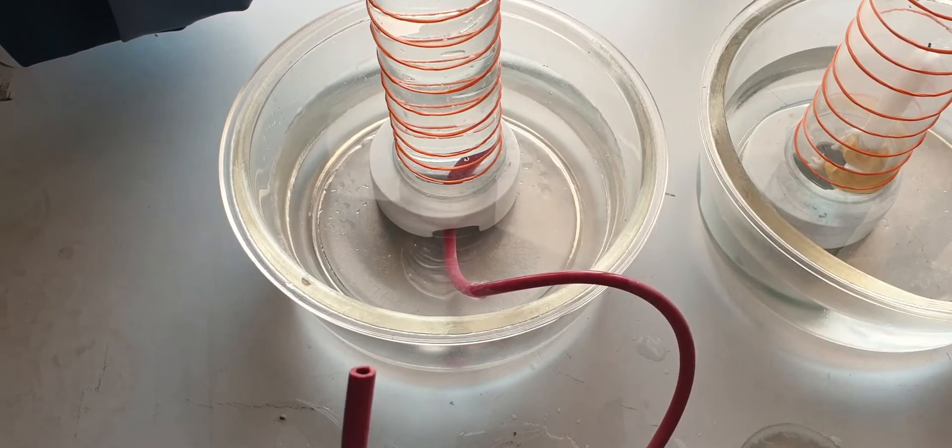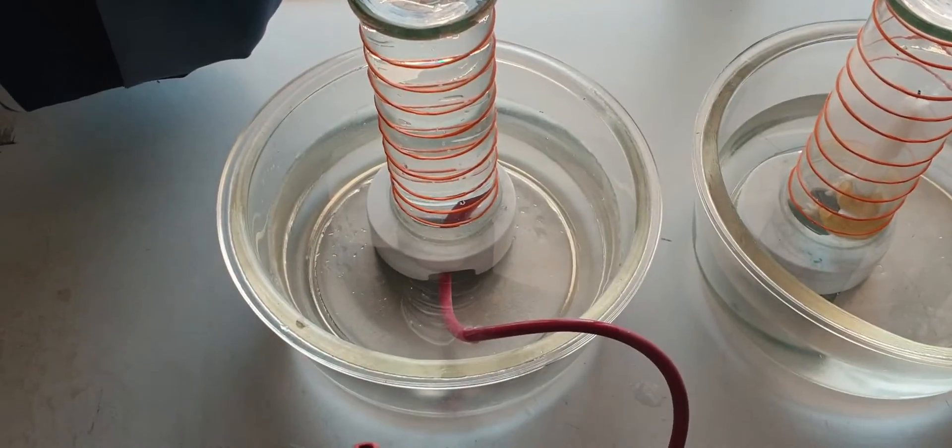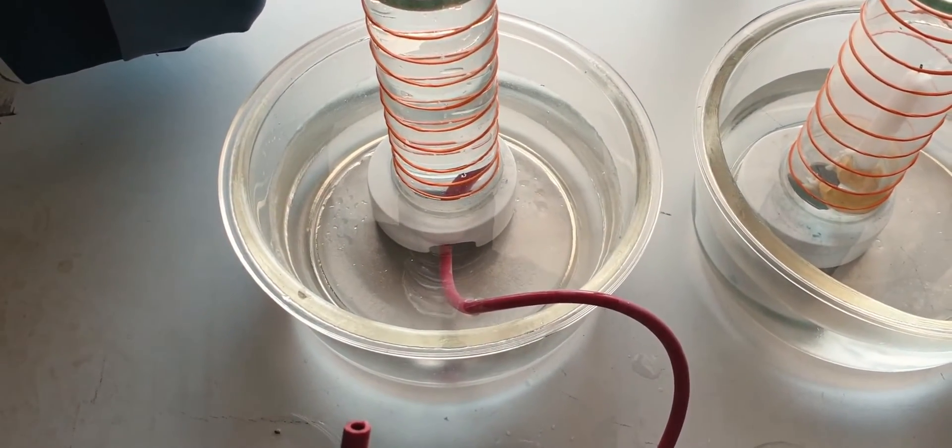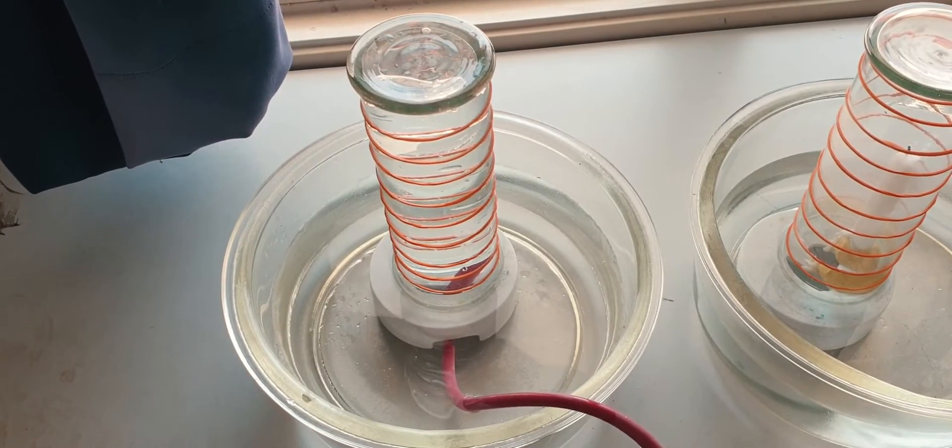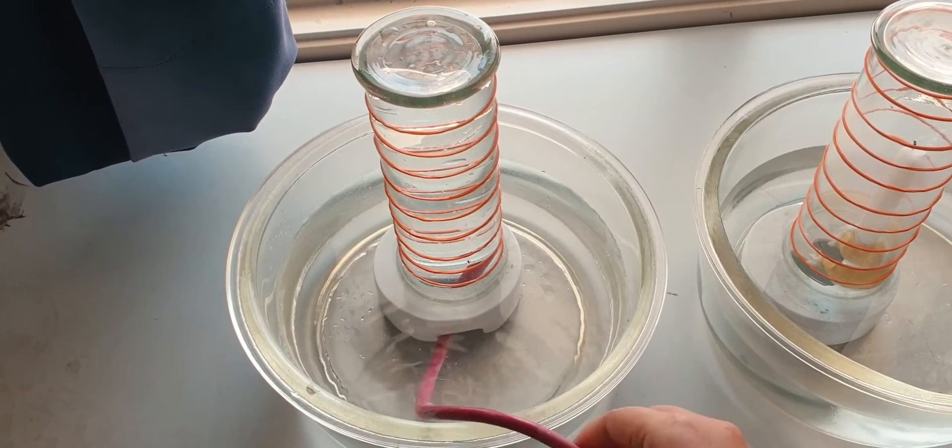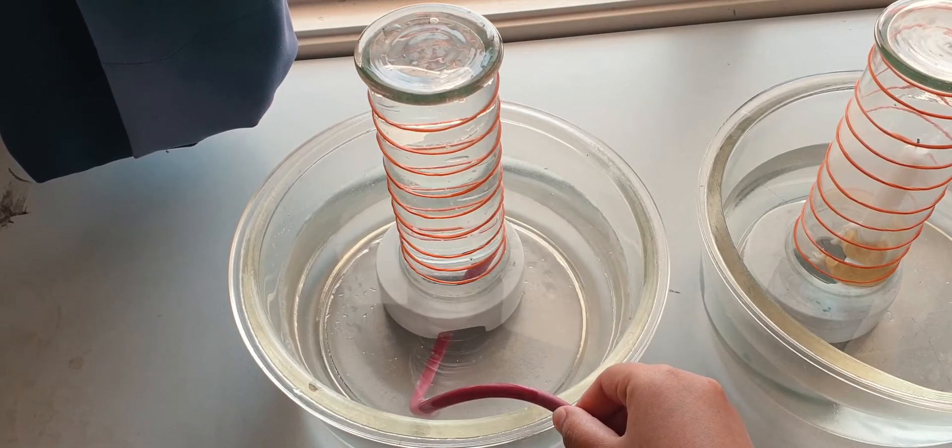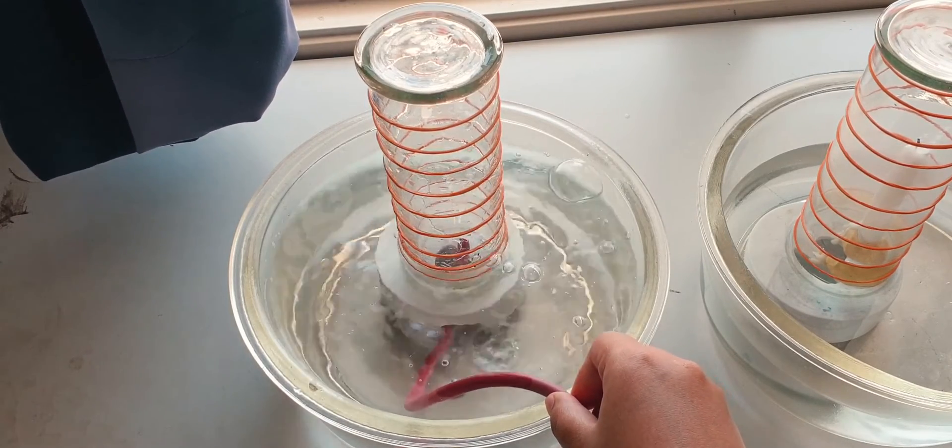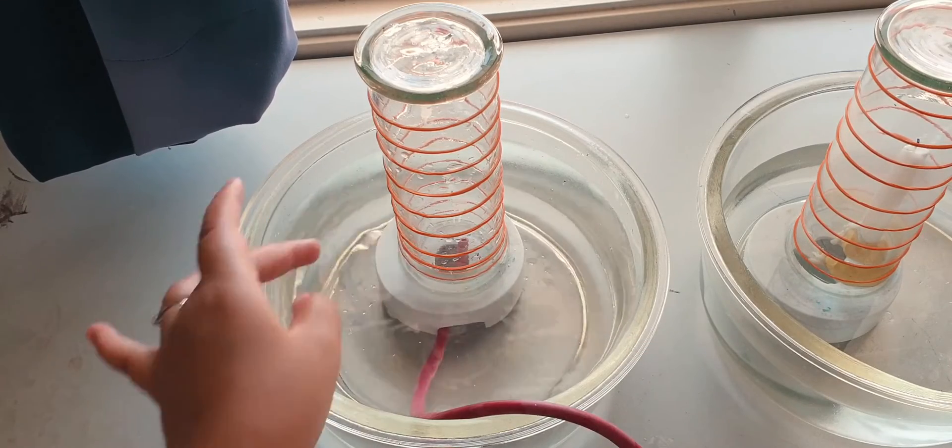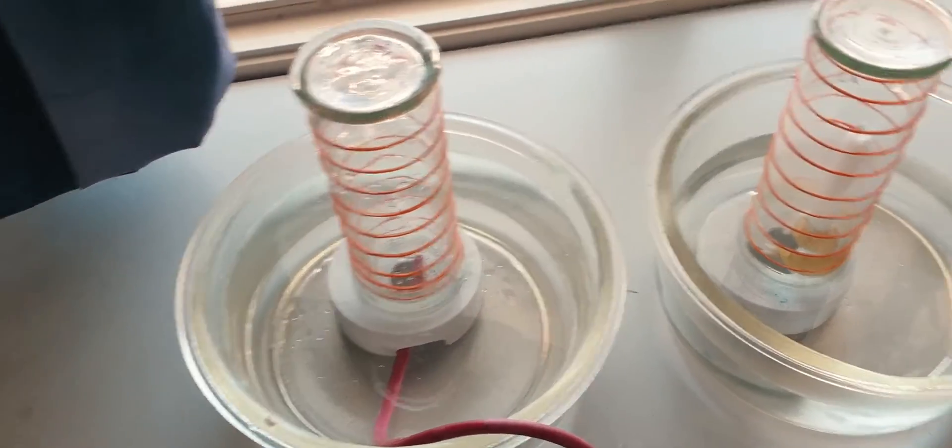What I'm going to do is I'm going to blow exhaled air through the rubber tube, so the exhaled air will fill the gas jar. It's just a water displacement method. The air that I blow in will displace the water out, so I'm just going to blow.